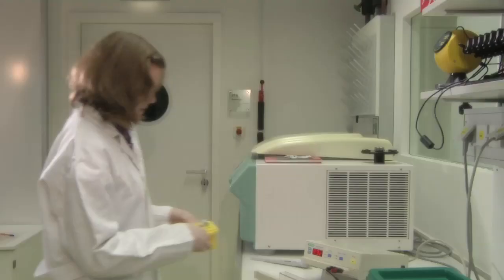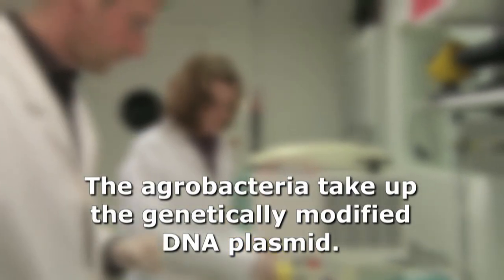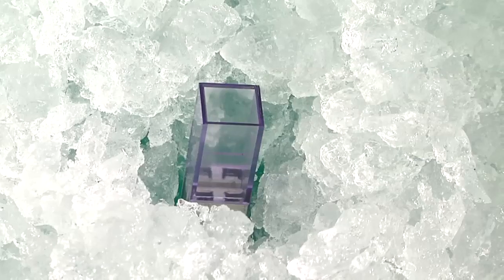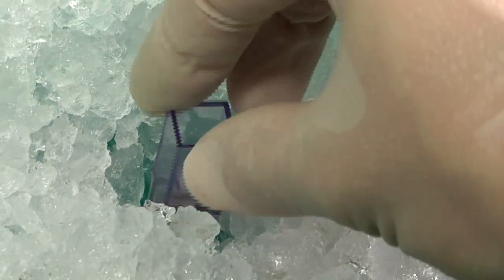And how do we get our plasmids carrying the gene of interest back into the bacterial cells? That's what I'll show you now. These are our agrobacteria. We'll treat them with an electric pulse, which will allow the plasmid DNA to enter the bacterial cells. In order to do that, I'll add the plasmid DNA that we prepared to the suspension of agrobacteria. And if you like, you can trigger the electric pulse.